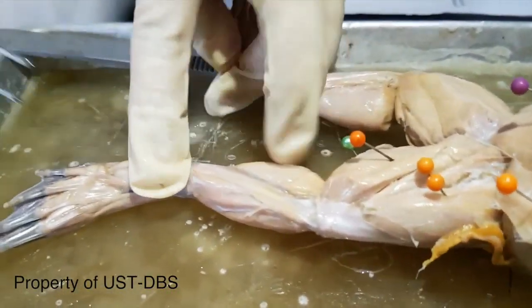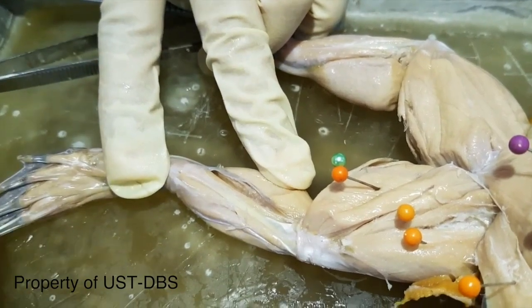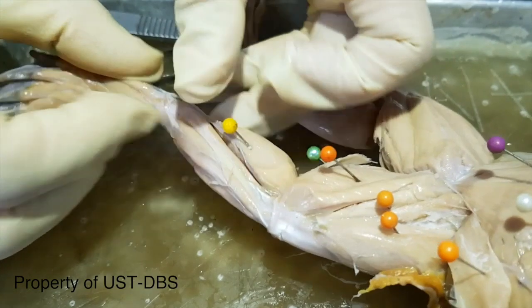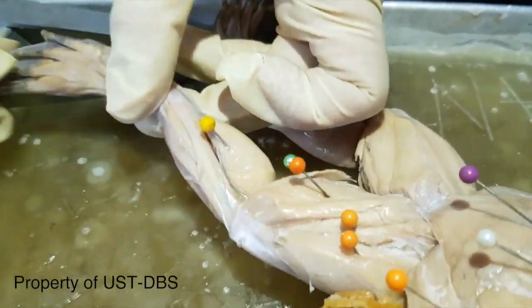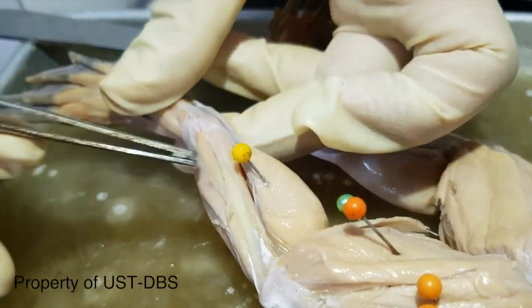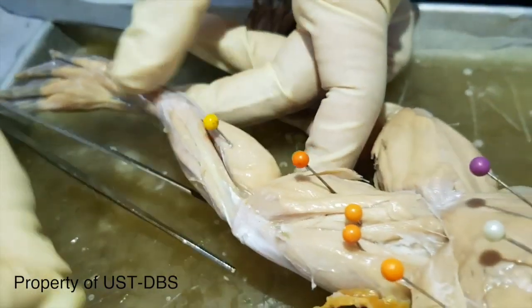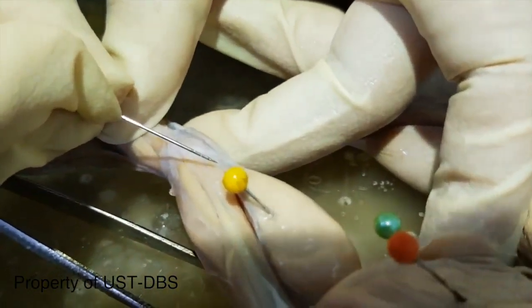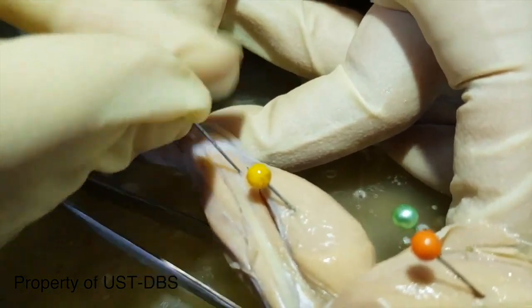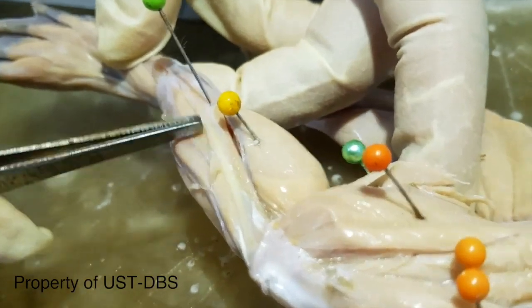Okay, so for the muscles of the shank, we already identified one previously, the gastrocnemius. In here, the point of reference now is this bone. That's the tibia bone. On this side, you will see that there is a small muscle. That muscle is the tibialis posterior. Then that's the tibia bone.